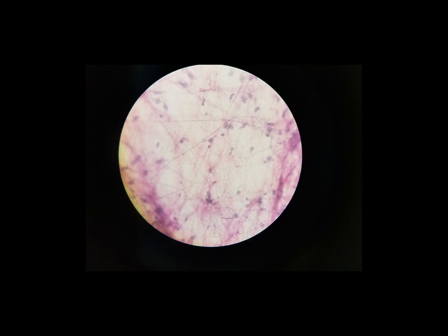And when we look at this slide, it's often really, really faint. It doesn't hold stain very well. This one is one of the darker stained areolar slides that I could find. And when we look, most of what we're seeing is extracellular matrix, and that's going to be true for all of the connective tissues that we look at, because that is something that makes connective tissue connective tissue.